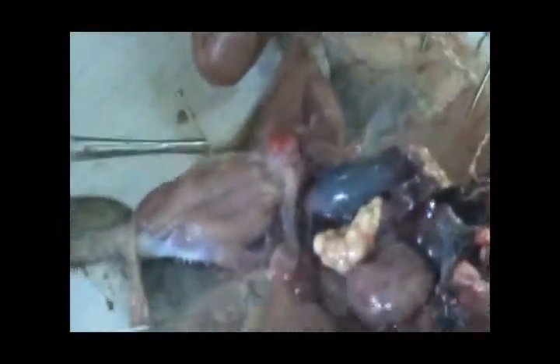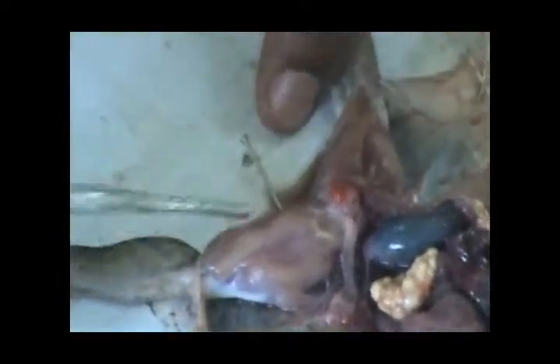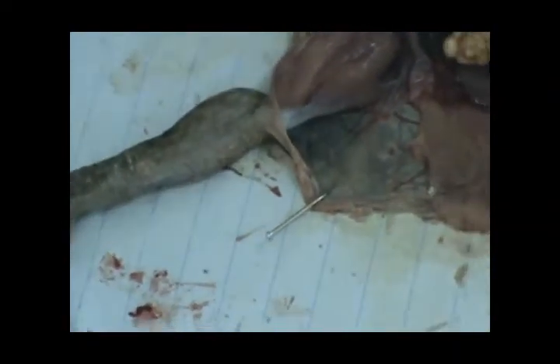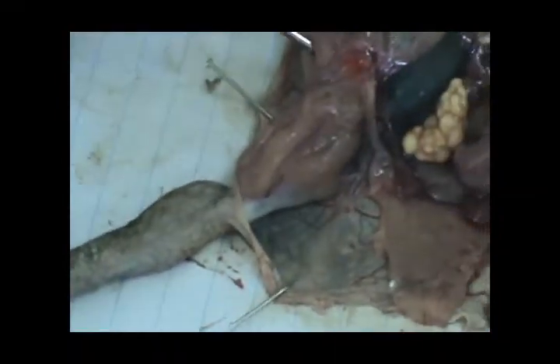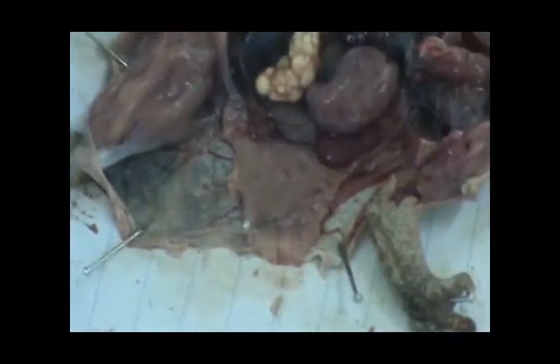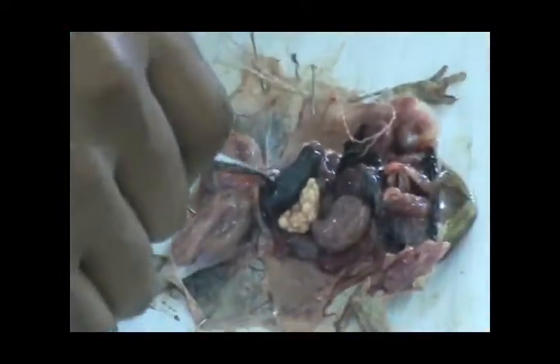There is also the sciatic vein inside the thighs. The femoral veins are the ones that connect with the pelvic vein from the anterior abdominal vein. The two branches that came from the anterior abdominal vein form the pelvic vein.